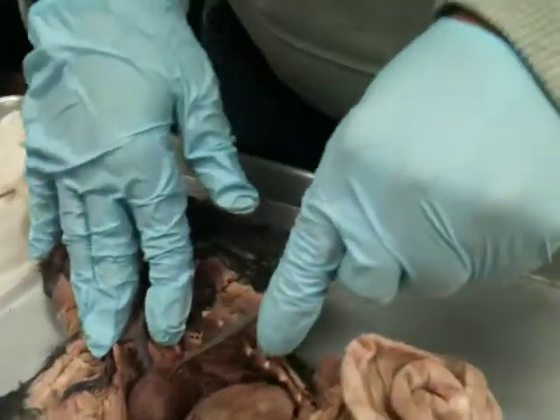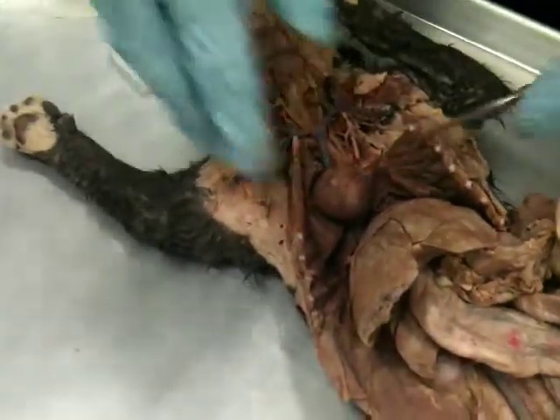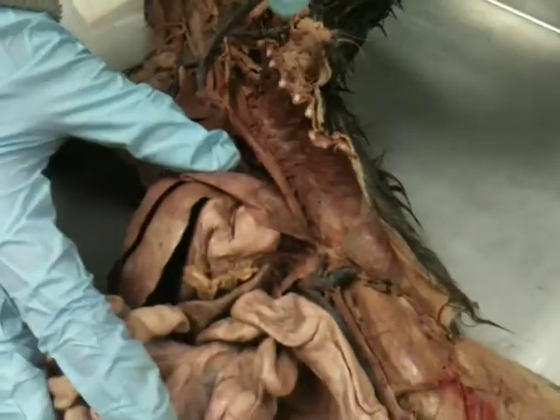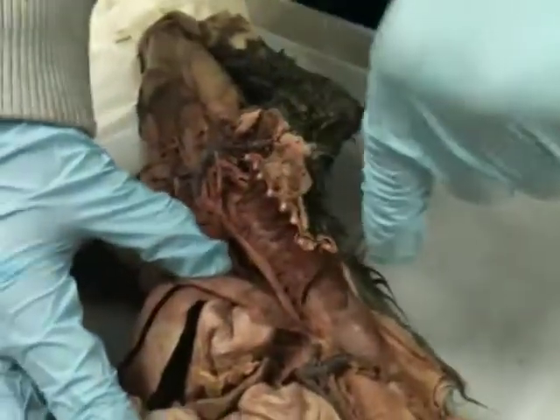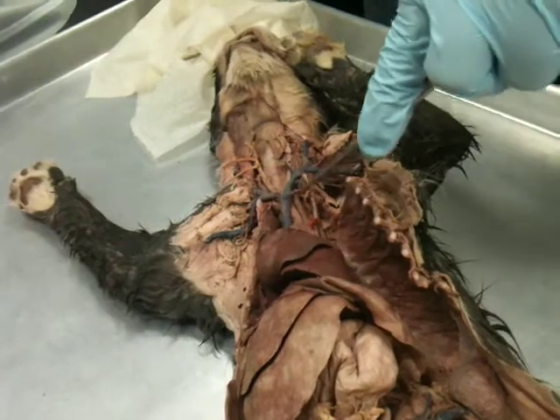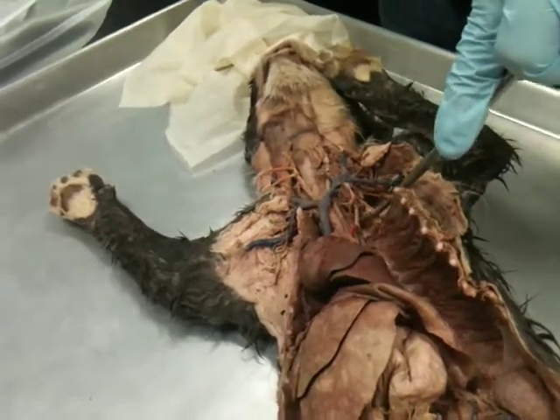Okay. So here we have the heart, and we have this big branch here that comes out of that left ventricle. And we can see that aorta. Remember, it travels all the way through the body. So here it is. There's that aortic arch, comes down through the thoracic cavity, enters into the abdominal cavity, and then branches. And you can see there are two major branches coming off the aorta. Remember, the vena cava had these two branches, but they are sort of parallel. These are kind of separate branches. We have the bigger branch on the right side and the smaller branch on the left side.